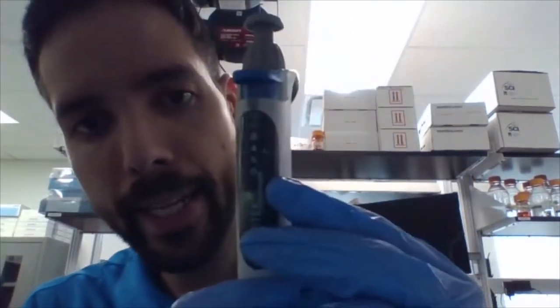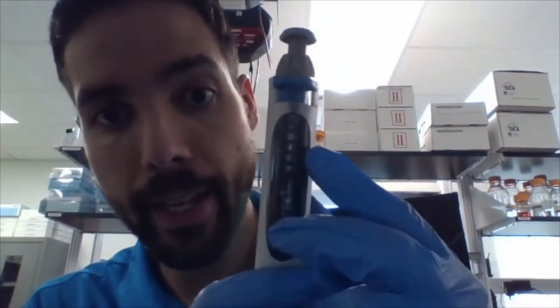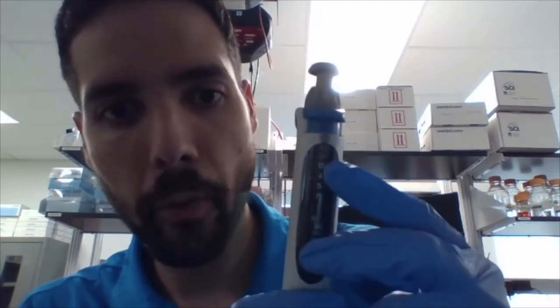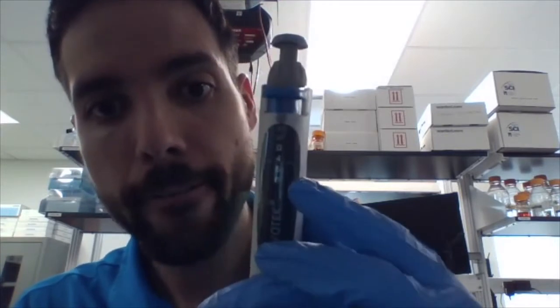This is my smallest one, P10. And the P10 actually has a line as well, but that's also a decimal point. So there's four numbers, zero, four, five, zero. This is not 450. This is 4.50. So four point, that line, five, zero.